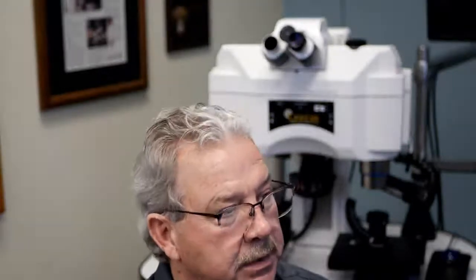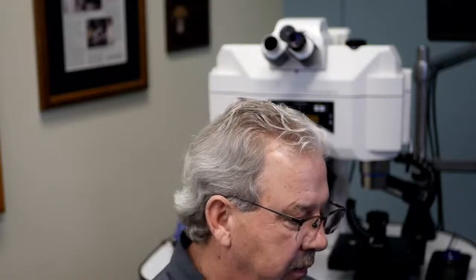Our CAD drawer did this neat little drawing for me here, and what you see is a series of concentric circles, the smallest being an 18mm field of view. The next one up obviously is 20mm field of view, then a 22, and finally the 23mm field of view. And again, you say, well, why do I care about this, Kevin? Why are we going through this?